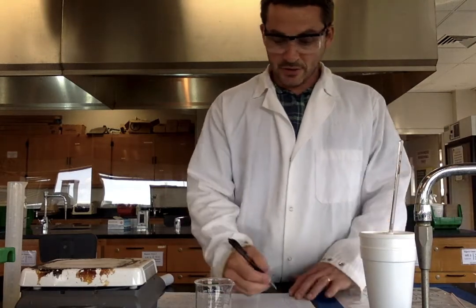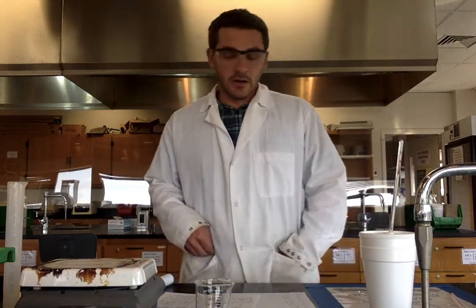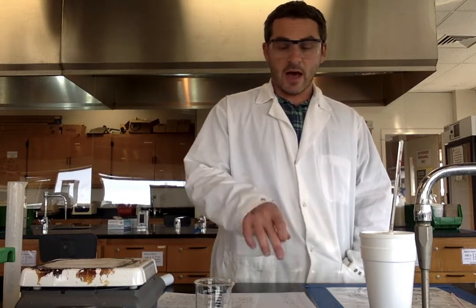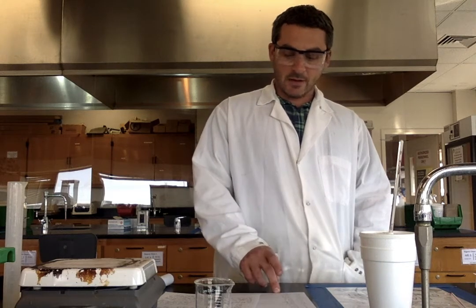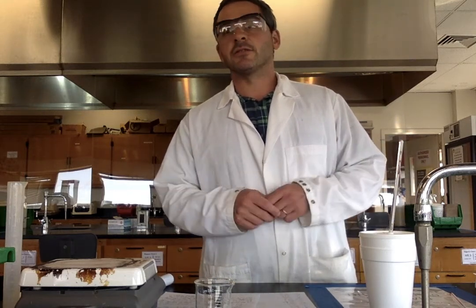All right, so for the initial temperature of the cold water, we had 24.0. Initial temperature of the hot water, 65.4. And then, again, T-final is determined by a graph. It is not the first temperature. The first temperature that I recorded, the highest temperature, was 58.8. That is not T-final. You determine it by a graph, right? It's explained in the lab manual. It will be explained on another video. But we ran all the way through, went from 58.8 down to 44.6. But you're going to use that graph to determine your T-final. So thanks for joining me today, and I'll see you again in the next lab.